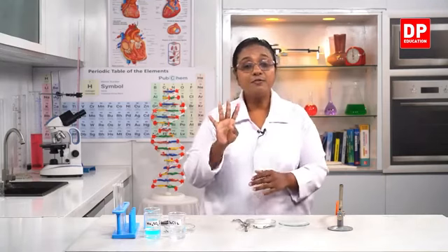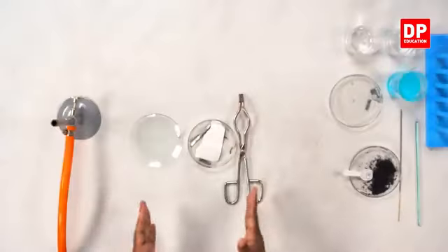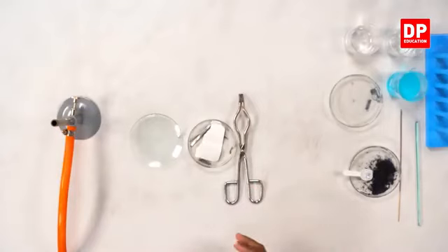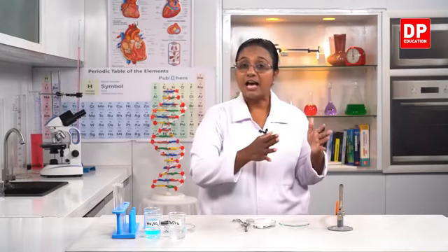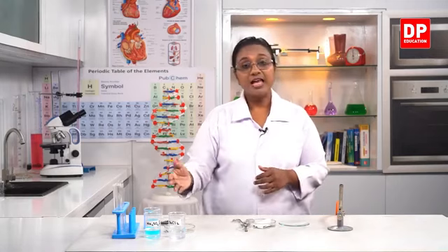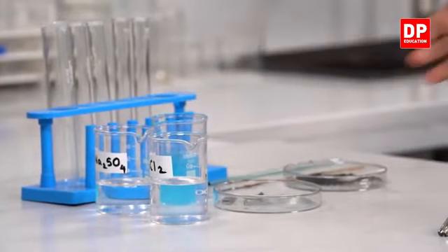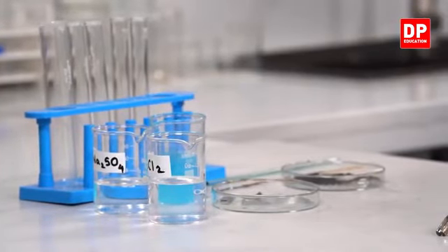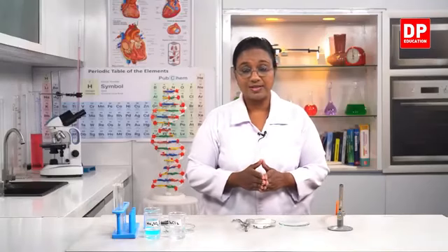So to understand the four ways in which the chemical changes take place, I have these substances. First, I will be using the magnesium strip. We have already done this reaction, burning the magnesium strip in a Bunsen flame. So there the magnesium strip will react with oxygen. So there we have two reactants. We will see what happens when the reaction takes place. Then I have potassium permanganate. Only one reactant. I will take the potassium permanganate into a boiling tube, and when I heat it, we will see what happens.